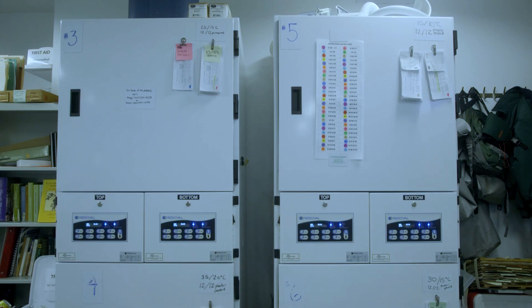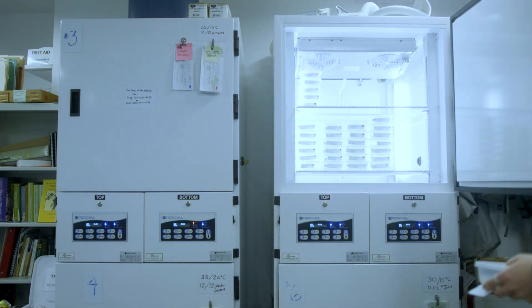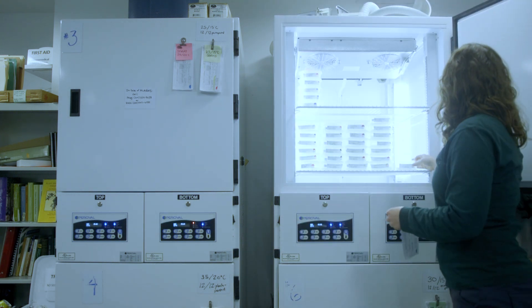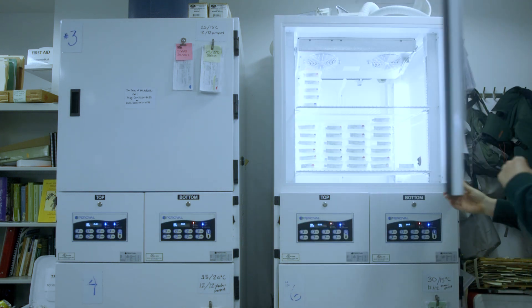After the test is planted, the plate gets moved to its next destination, which could include a warm or cold stratification or directly into its germination temperature.